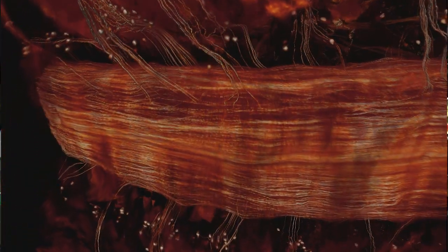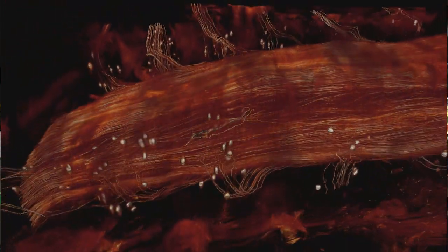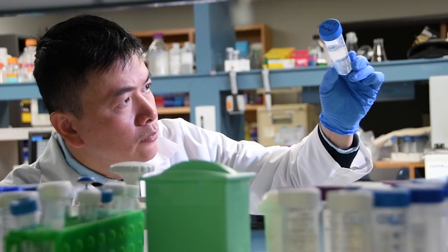For example, we were able to see how blood vessels and nerves are distributing within the dental pulp and within the periodontal ligament (PDL) space — images no one had seen before. The 3D information provides a more comprehensive diagnostic result than 2D sections, and I believe in the very near future this will become the standard for pathological diagnosis.